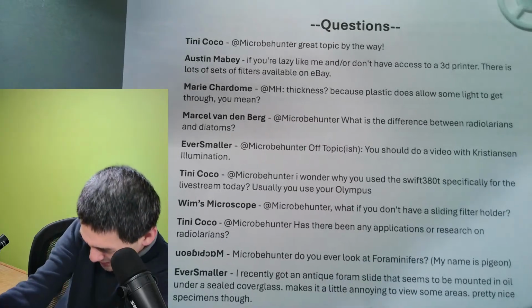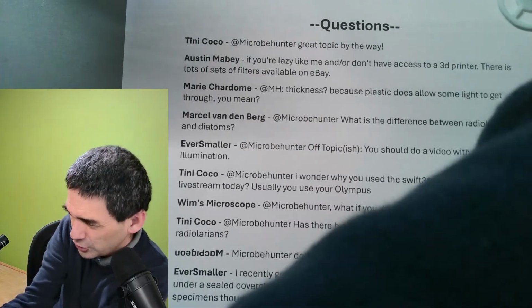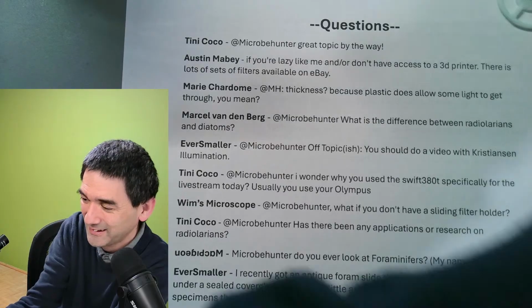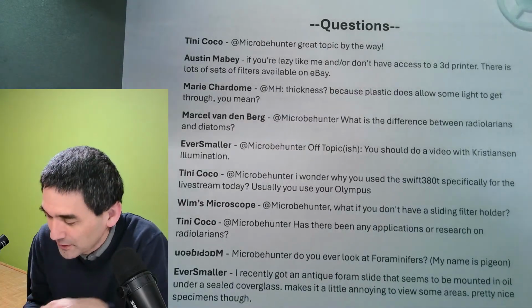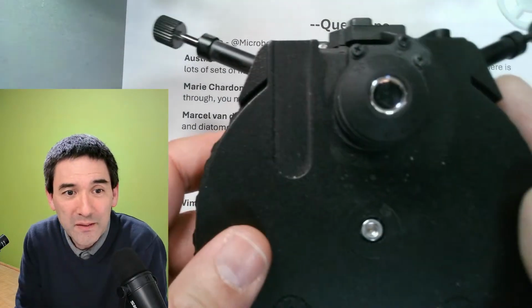I have to. No, I can't. Can I do this? Let me see. I'm going to show you. I'm taking apart my Olympus now. Okay. Let me see if I can get this out here. It's a little bit dusty, so maybe it's a good idea to get it out.